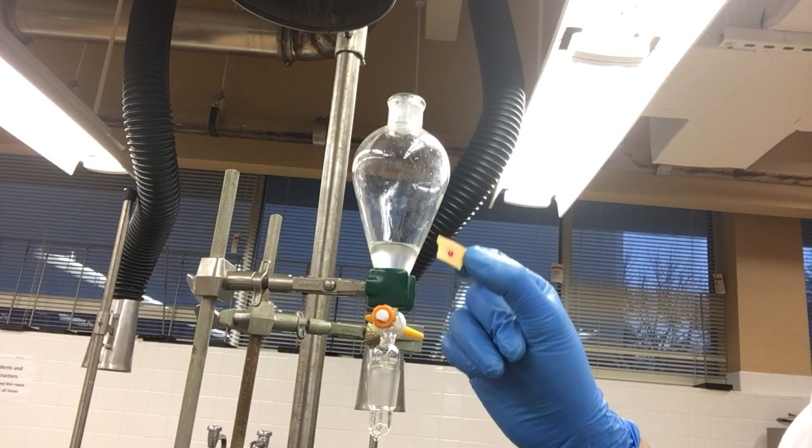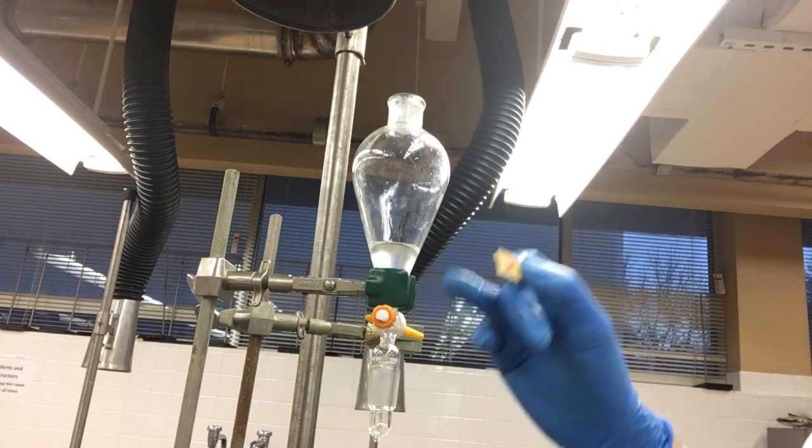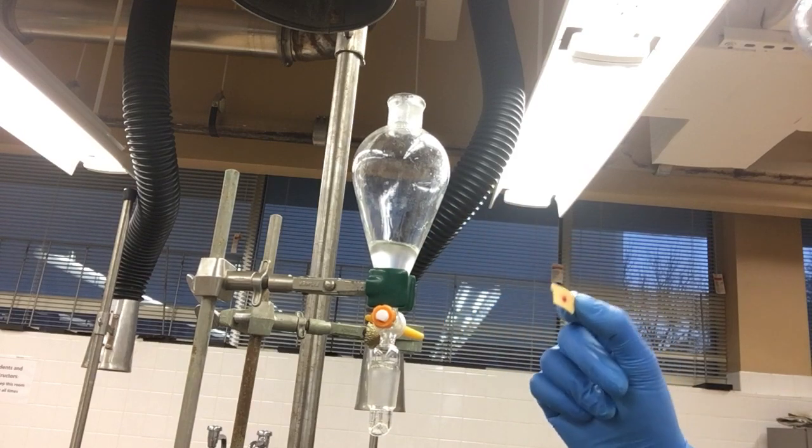me it's acidic. This tells me that it's the acid, confirming that the other layer, the top layer, is the organic layer.